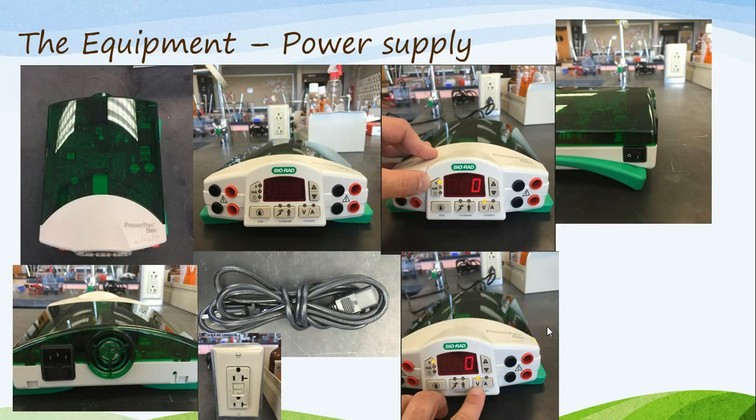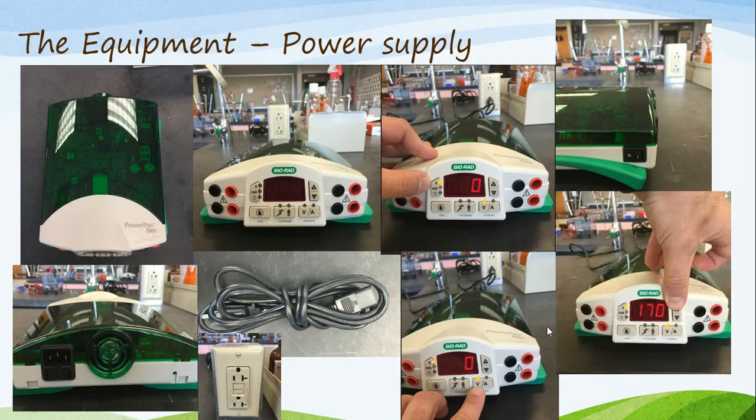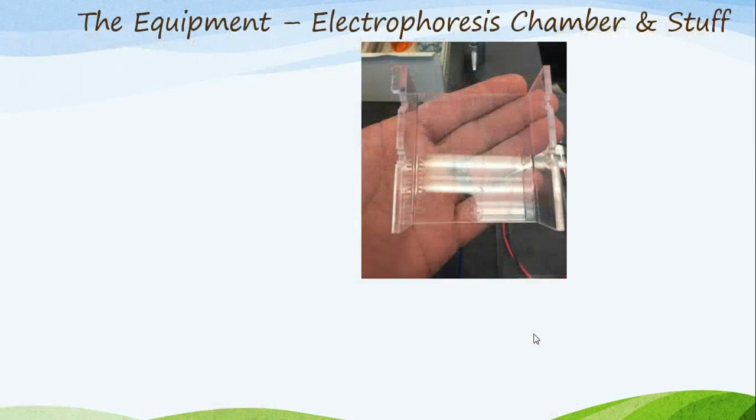Other things you will need to know about the power supply is you can adjust either the voltage, milliamps, or the time frame in which you want to run the gel. The only thing that you're going to actually be adjusting is the voltage. So making sure again that the V is lit here and here, you're going to want to raise the voltage using the up arrows, considering we are raising it up. And you're going to press that button until you reach the desired value as specified by your teacher. That was the power supply.